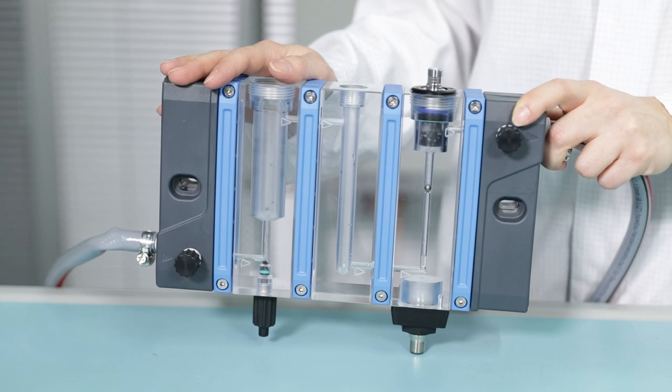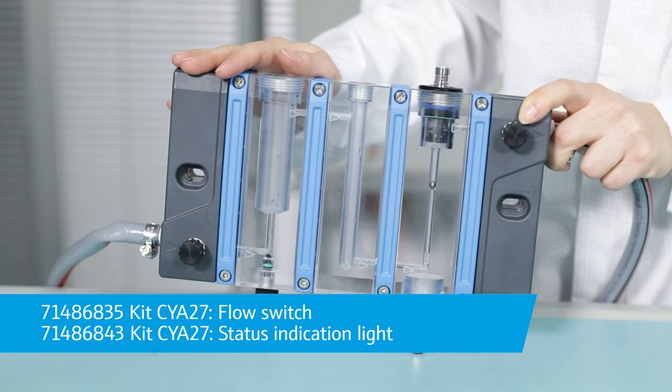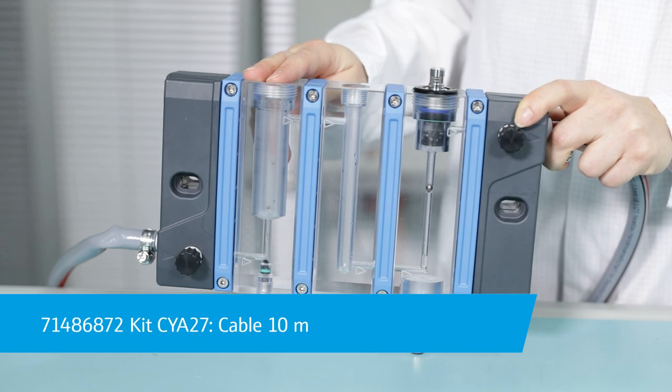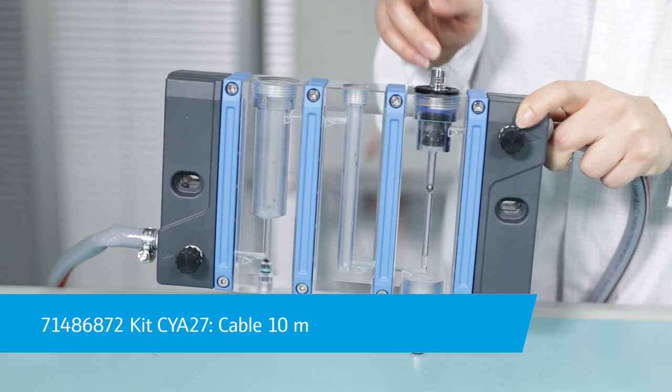This is a pre-configured CYA27 assembly. It has a disinfection module, a pH module and a flow module.